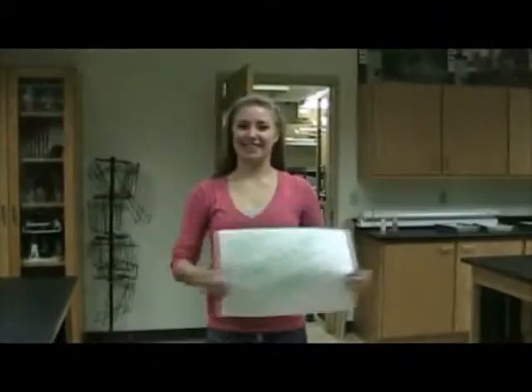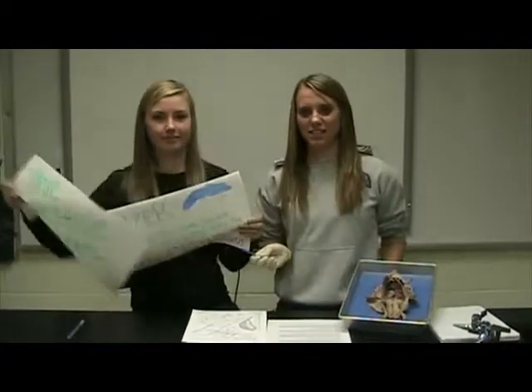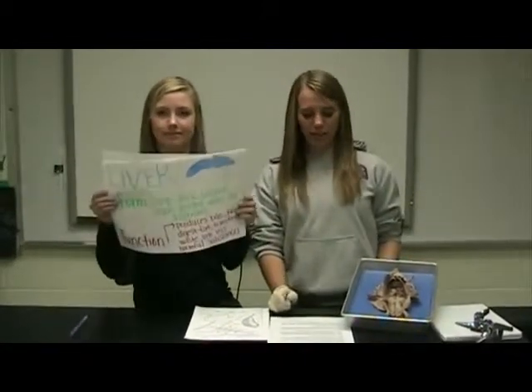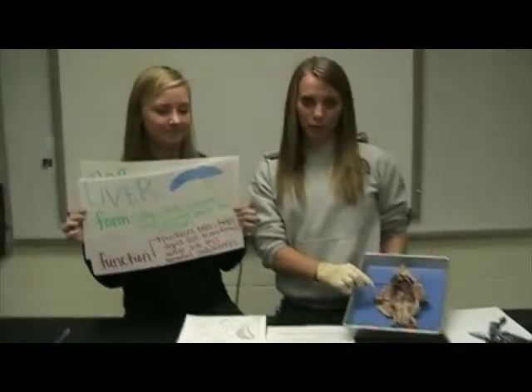Now let's take a step from superficial to deep inside Sebastian's body, otherwise known as outside to inside. The digestive system. Now we will talk about the organ system that deals with processing food, the digestive system. Our first organ on our trip is the liver. The liver has 3 lobes and is bright blue in our rat.